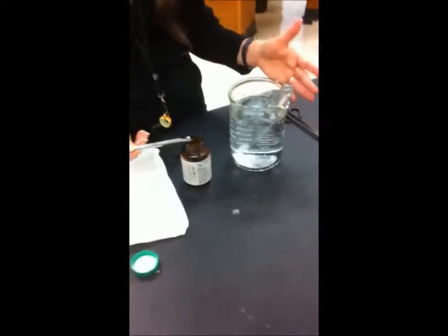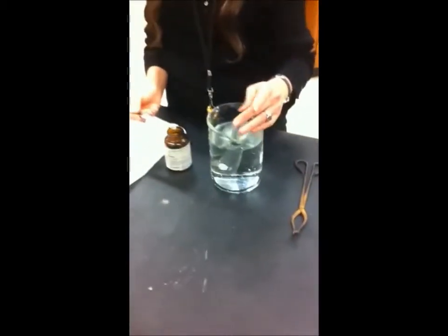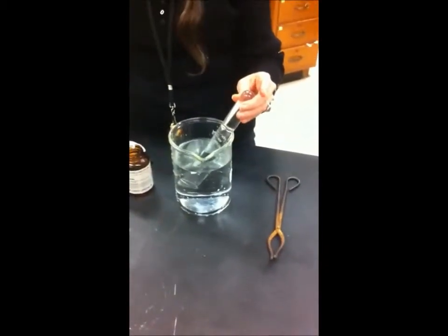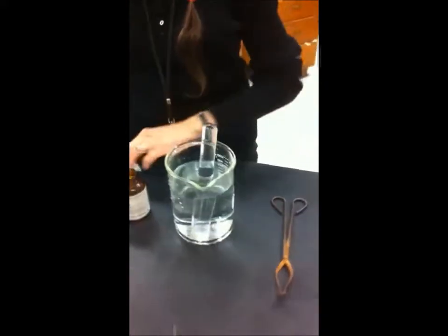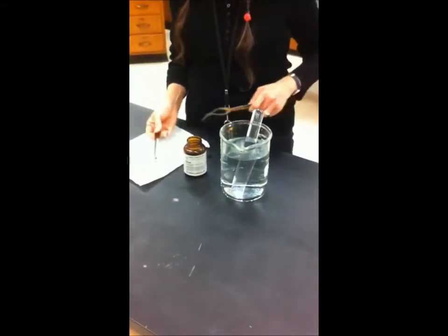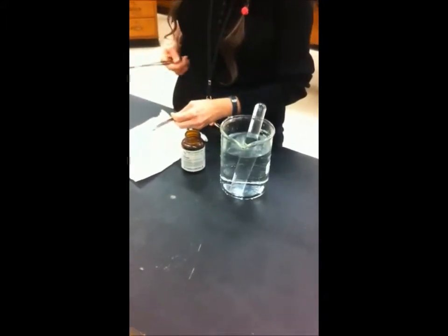The contraption that I'm using is just a regular 1 liter beaker with an inverted large test tube full of water. Most of these reactions, we have just placed the sodium in the water and let it skitter across the top. But what I want to do is collect any gas produced.